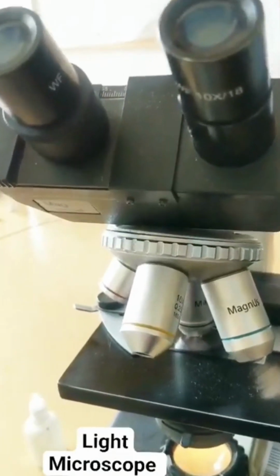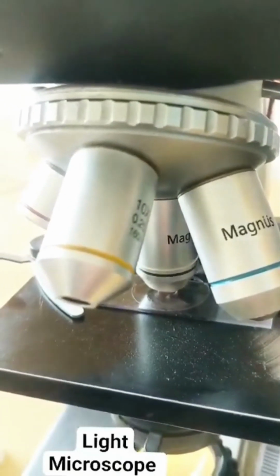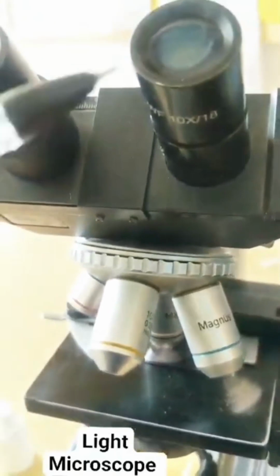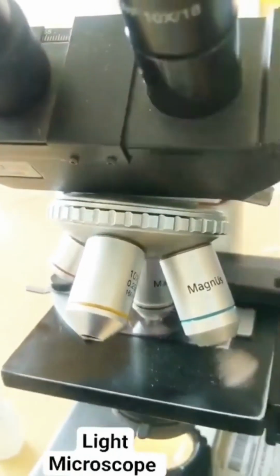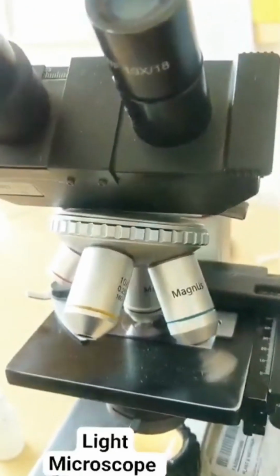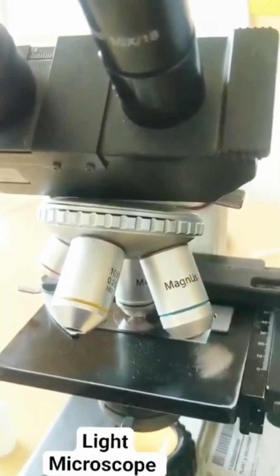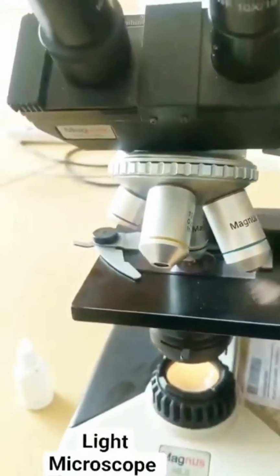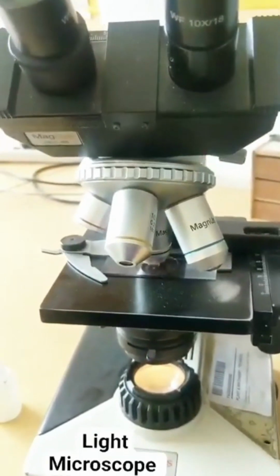For example, I'm using oil immersion. See, the slide is in oil immersion. What is the magnification of oil immersion? 100x. What is the magnification of the eyepiece? 10x. So what is the total magnification that I've got? 100 into 10, that is 1000x. That's the maximum magnification I can get in this light microscope. So these were the parts of a light microscope that you have to know, which is very, very important for your exam.